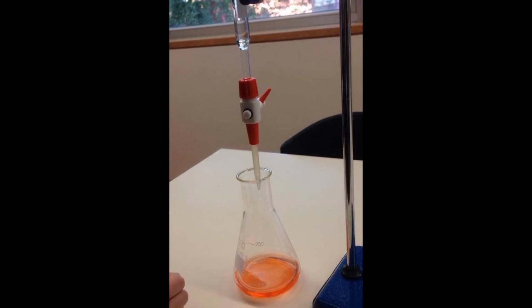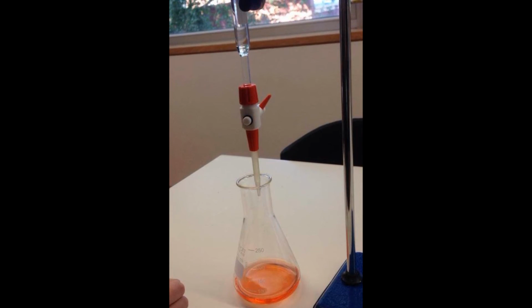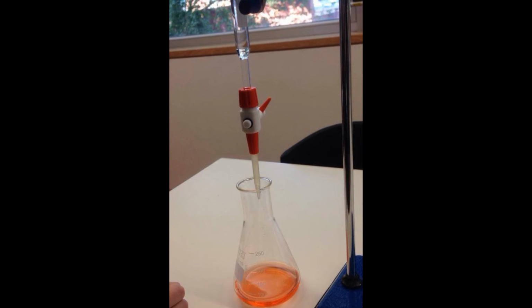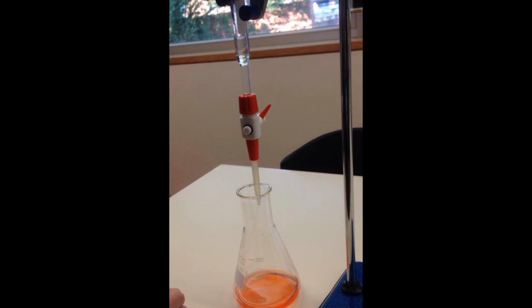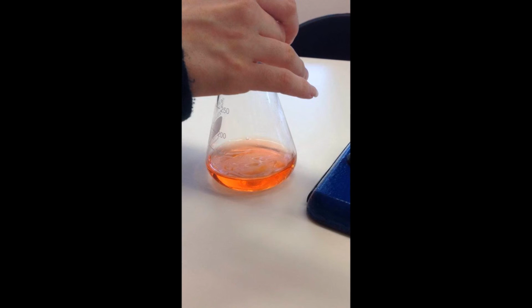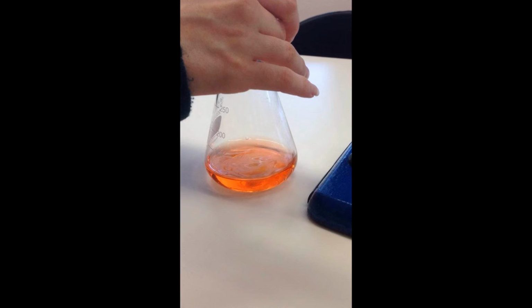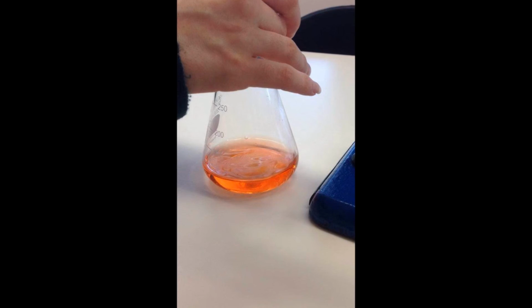For best results, the first titration is discarded and the titration is repeated another 3 times, repeating all steps including cleaning of equipment. In repeated attempts, the rough idea of the equivalence point can adjust the titration accordingly. Before beginning each time, note the starting point of the burette, so you can accurately measure the change in volume each time. Be careful when near the equivalence point.